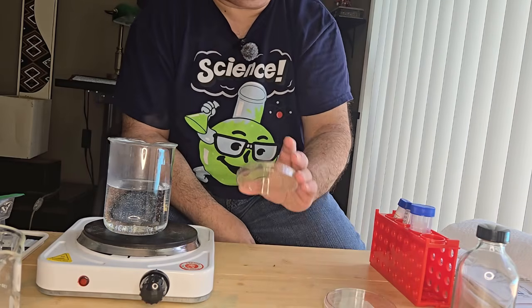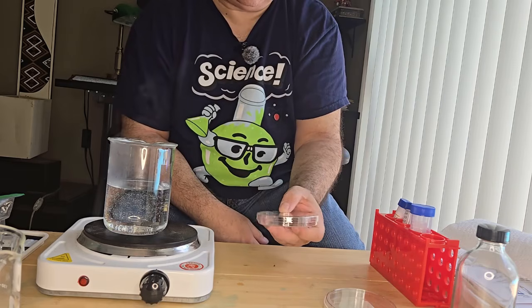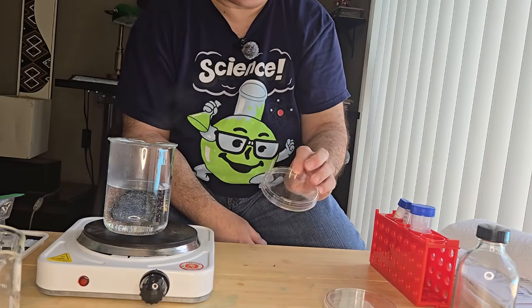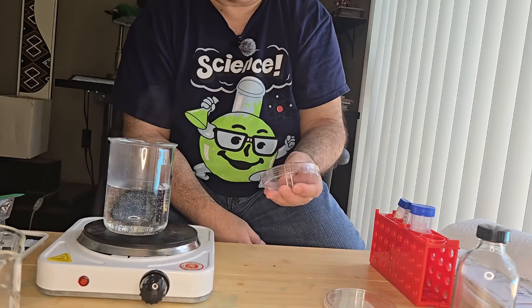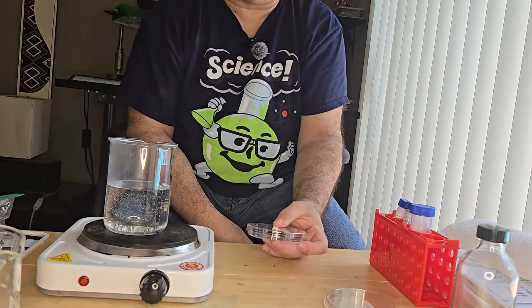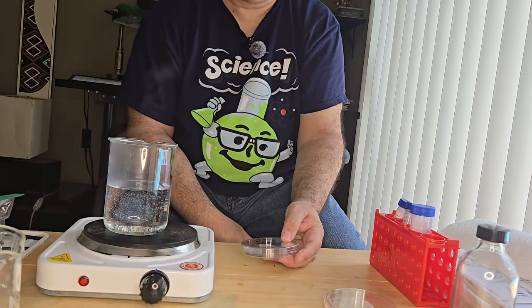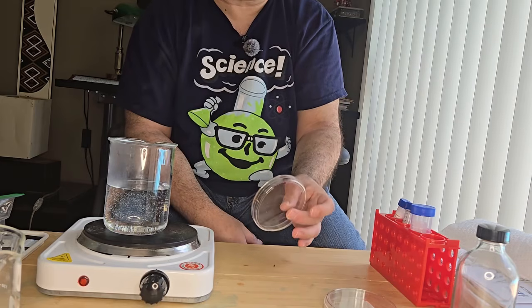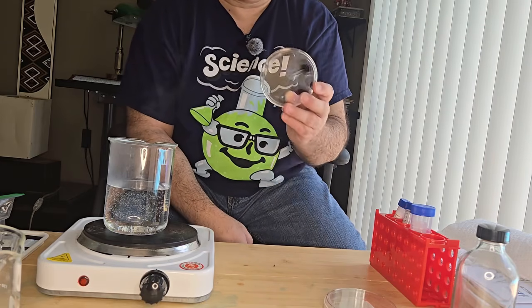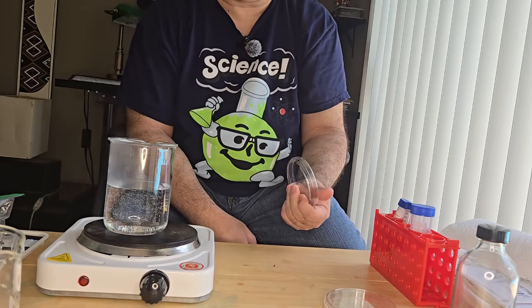And then my second plate will contain streptomycin and kanamycin in LB agar, and that is used for the final step of the experiment to show the transformation and the CRISPR reaction taking place, because normally, remember that E. coli doesn't normally grow on plates with streptomycin.